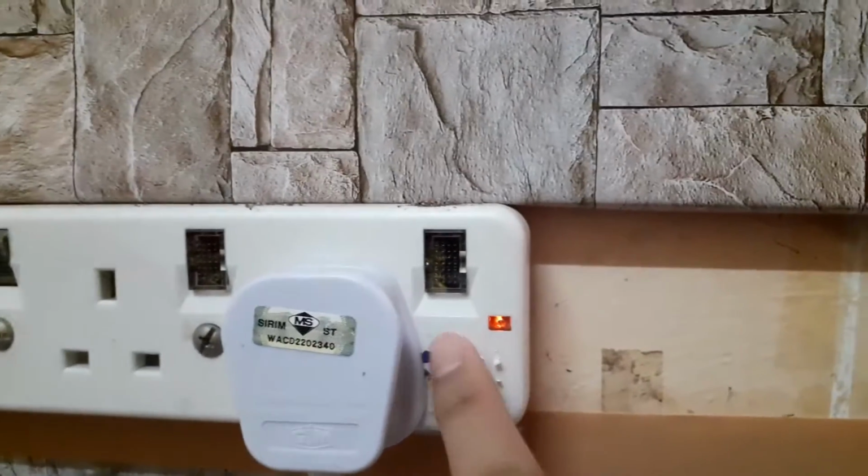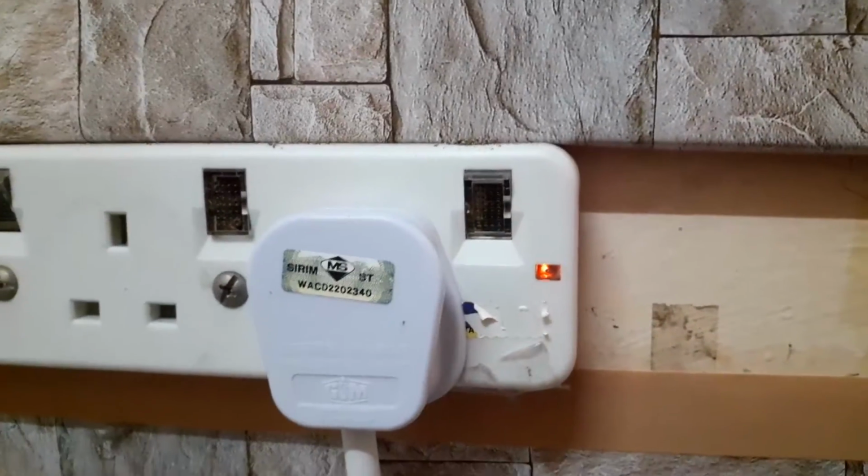Okay, for the procedure, firstly, switch on the computer. Next, click the image capture icon and choose the live measure icon. And then switch on the microscope, put the sample on the workstage, place the sample under the magnification lens, bring up the workstage by adjusting the coarse focus slowly until the sample is close to the magnification lens.